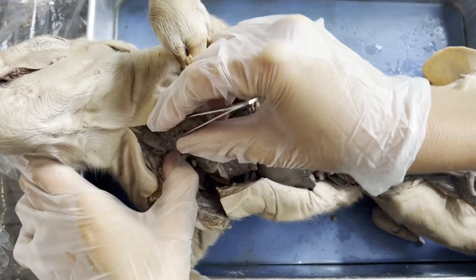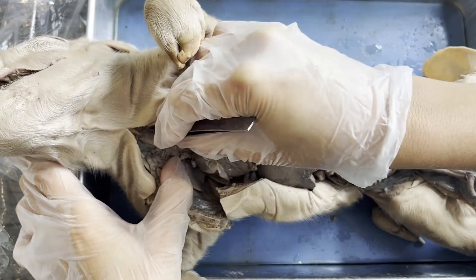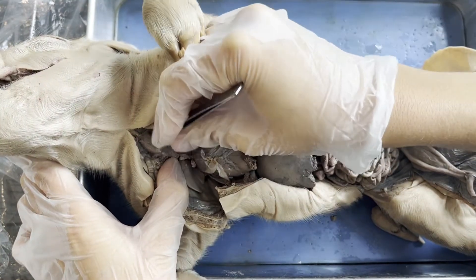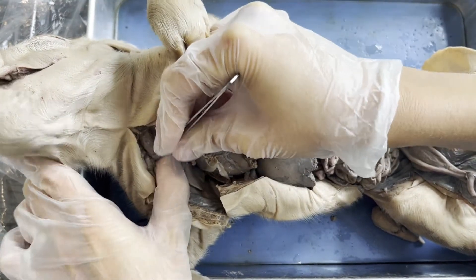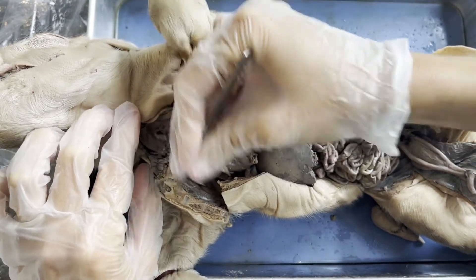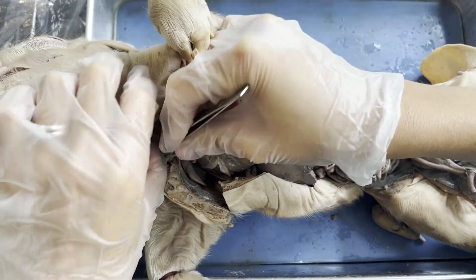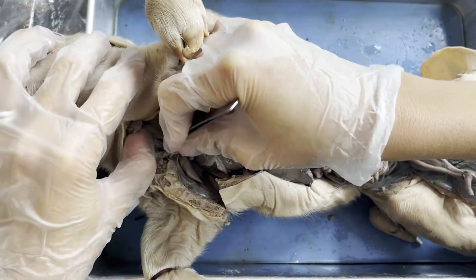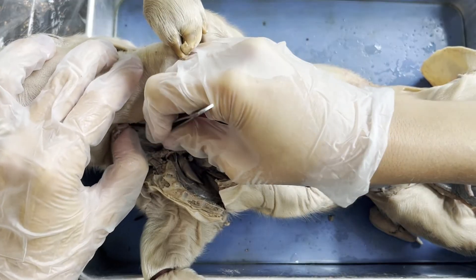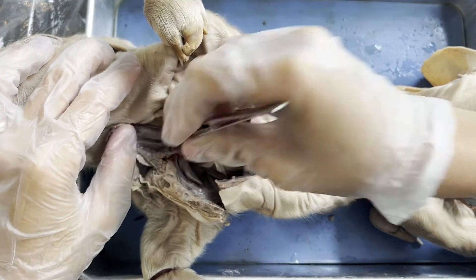I'm going to carefully try and dig under it and remove the thyroid gland. Now that the thyroid gland is kind of out of the way, we'll just let it hang out up there.